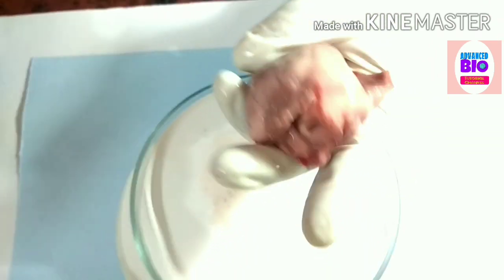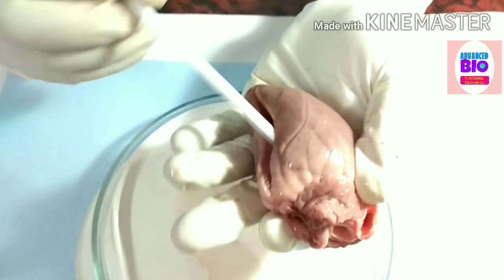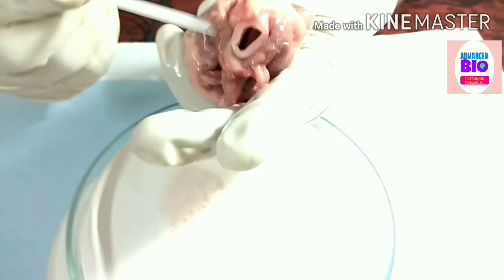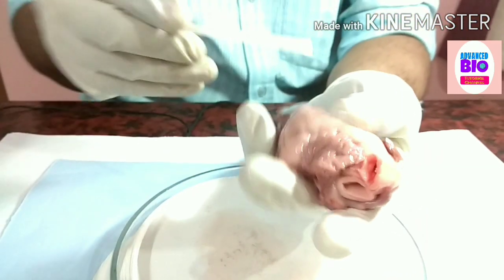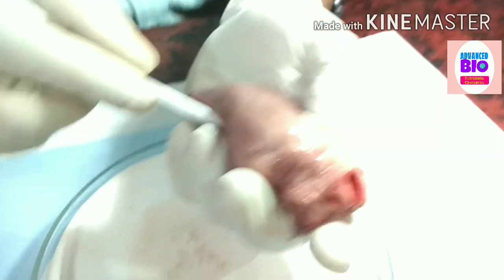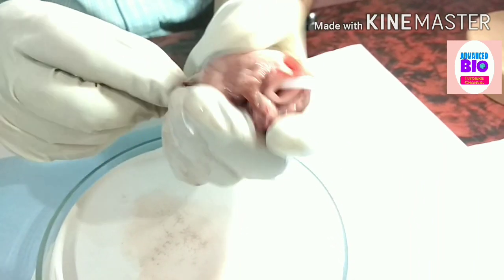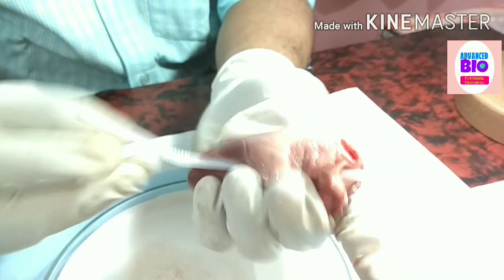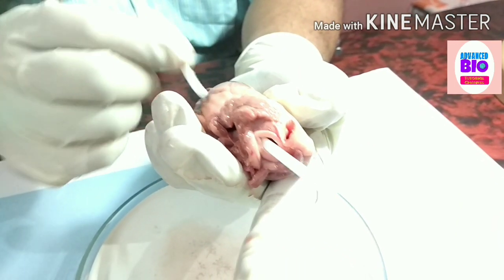You know this is the left ventricle and this is the right ventricle. From the left ventricle, the aorta is formed. See — I am penetrating this probe from the left ventricle and see, this is the aorta.